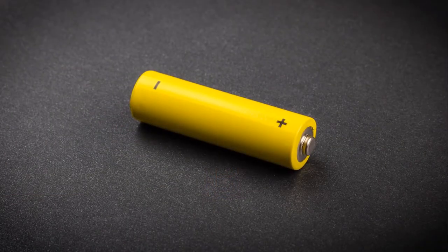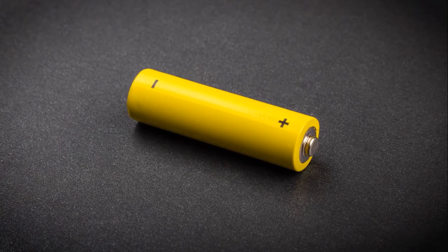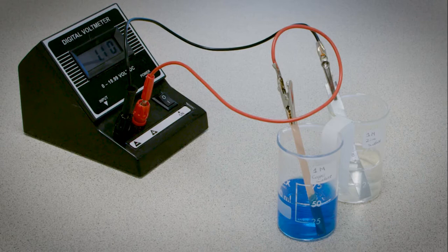An electrochemical cell is a device that is able to produce electricity from chemical reactions. Examples include standard batteries found in almost every home. Here is a working electrochemical cell producing a voltage reading on the voltmeter attached. This experiment describes how to set up an electrochemical cell and how to calculate the cell potential.